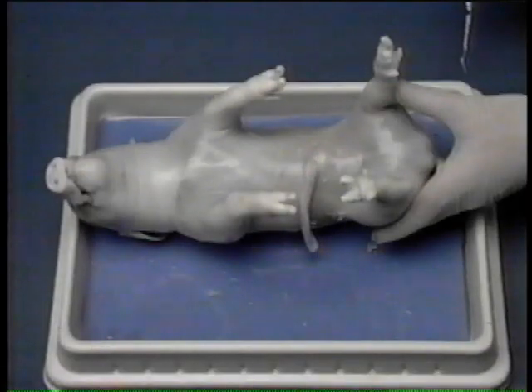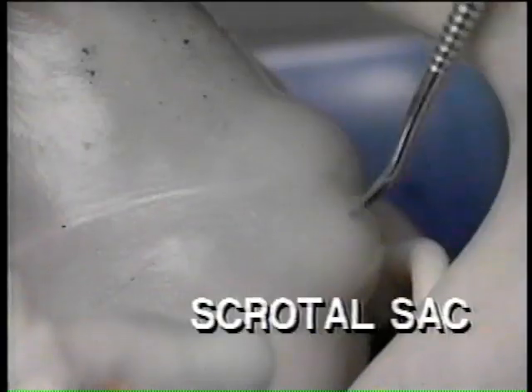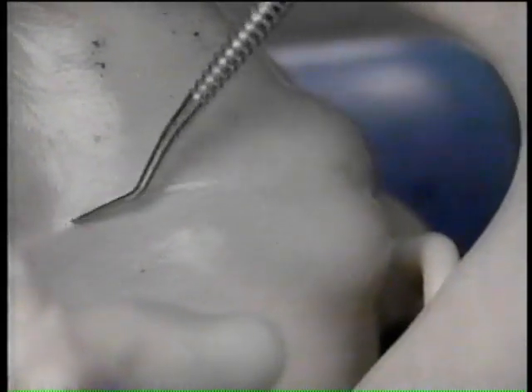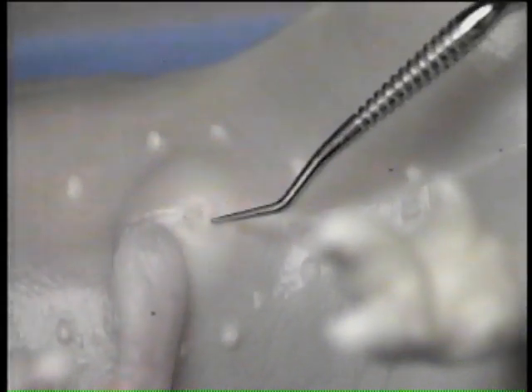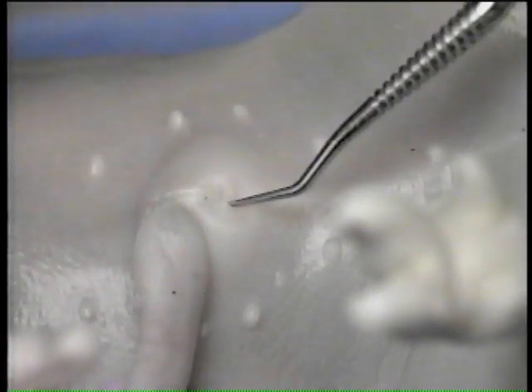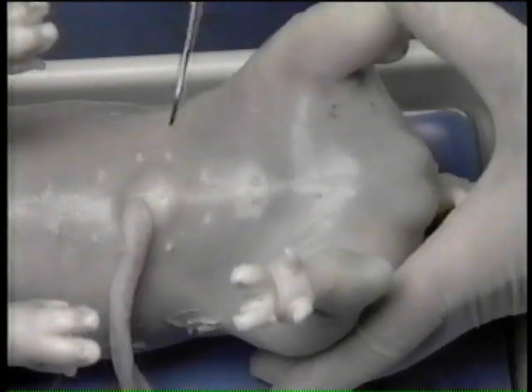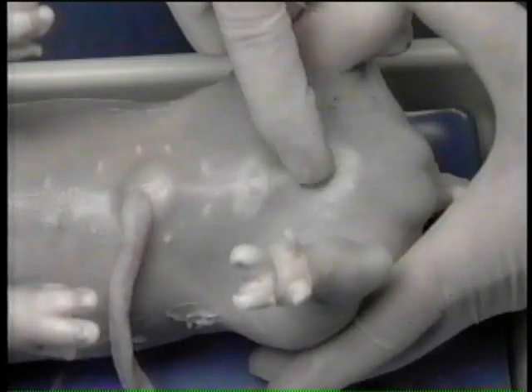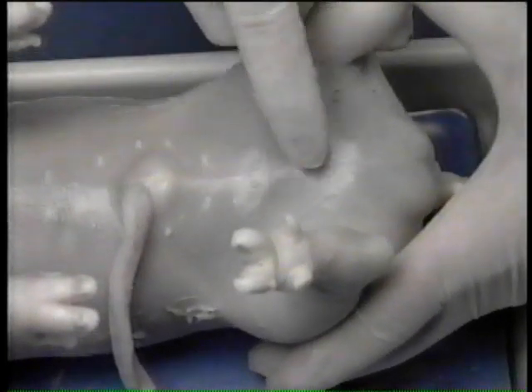Now determine the sex of the specimen. The presence of a swelling called the scrotal sac at the caudal end of the body, as well as the presence of the urogenital opening just caudal to the umbilical cord, indicates that the specimen is a male. It is also possible to feel a long, muscular, tubular structure lying under the skin proceeding from the urogenital opening.